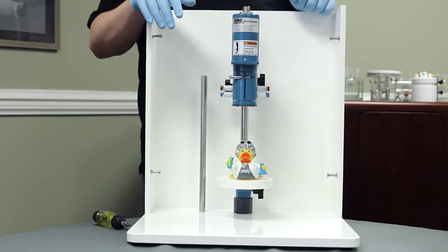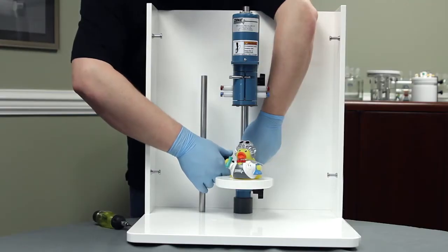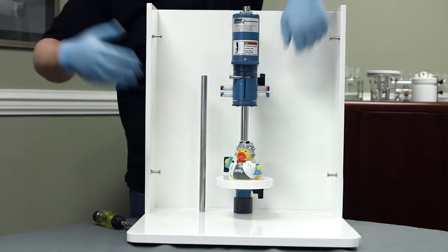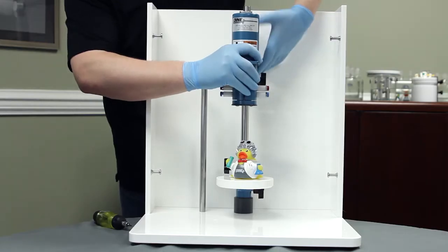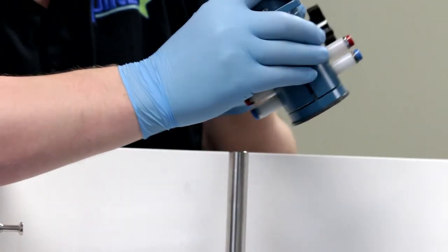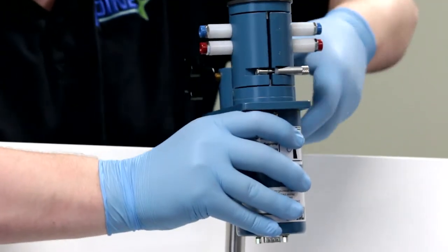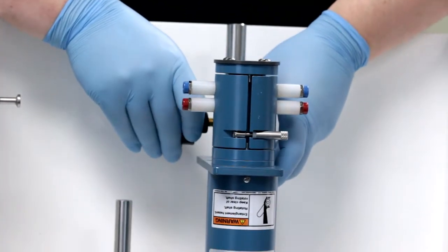So with the motor fully disconnected, we're going to lower this so that I can invert this and work on it a little bit lower to see what I'm doing. Simply loosen, slide off the motor unit, invert it, and then carefully slide down.